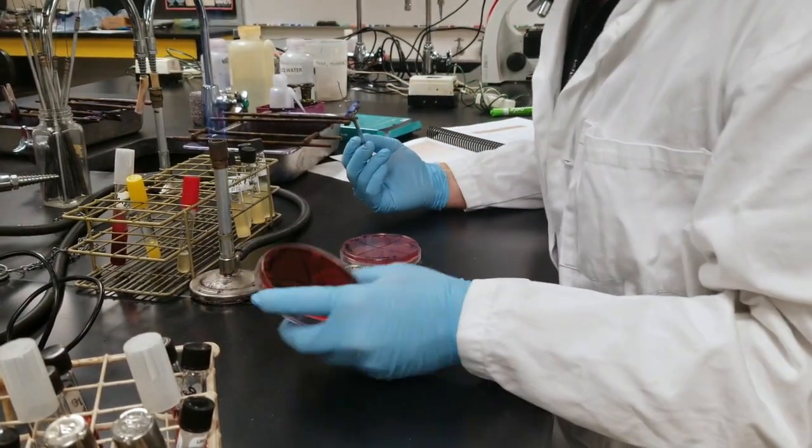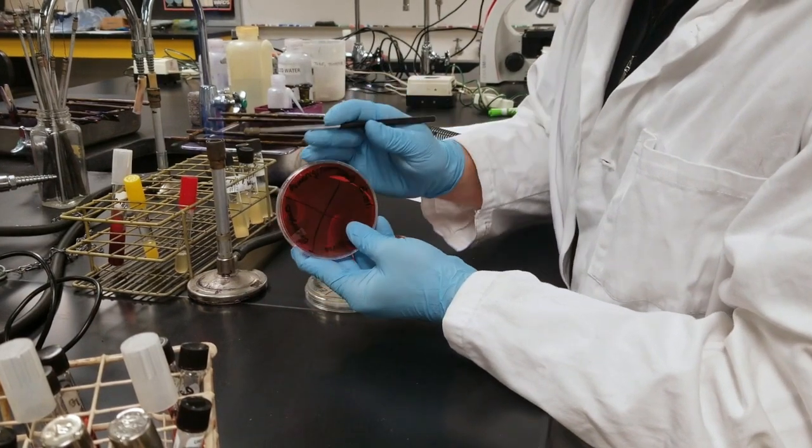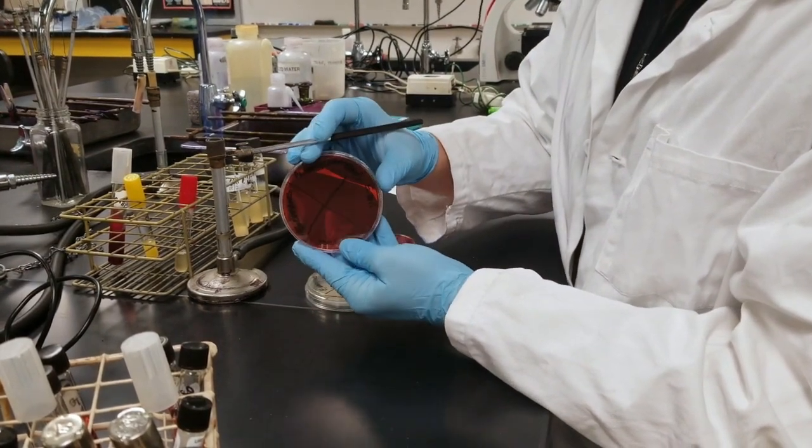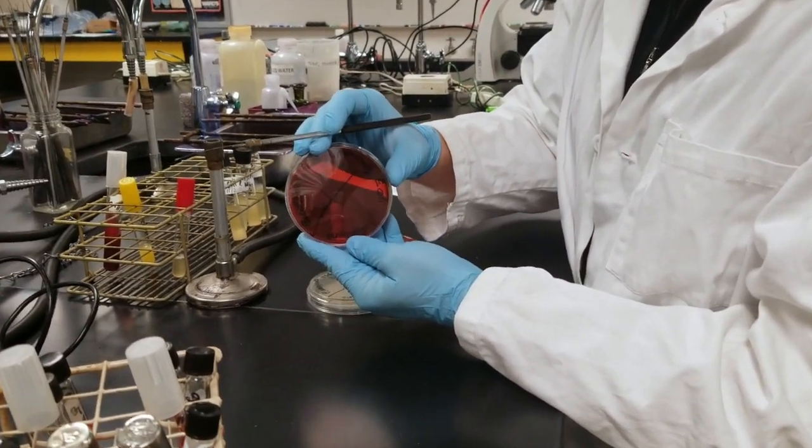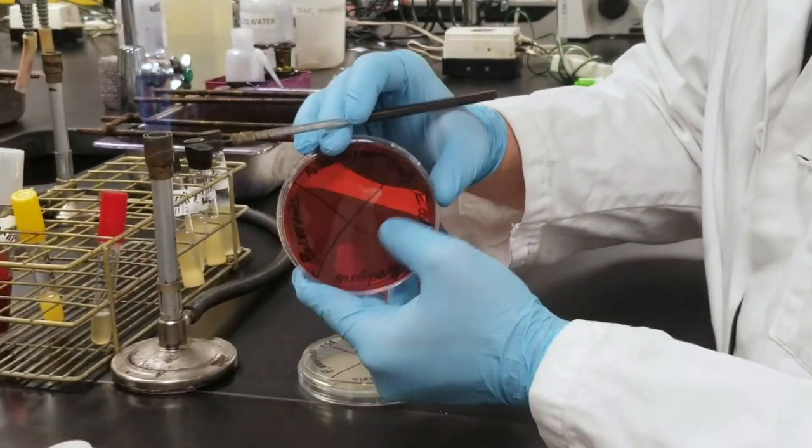For each plate, we split them into quadrants so all of the bacteria can be plated into each individual quadrant.